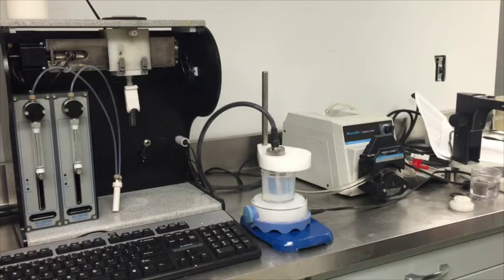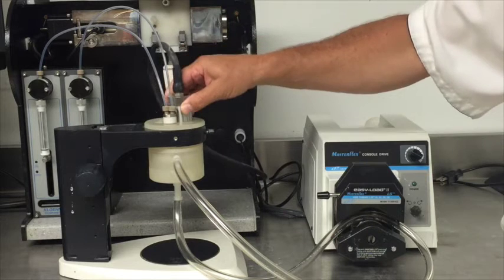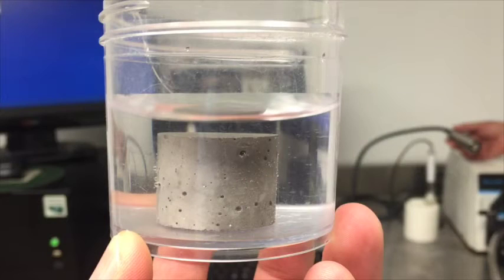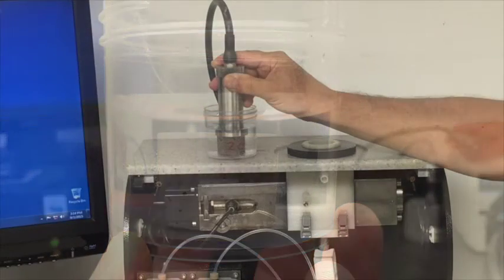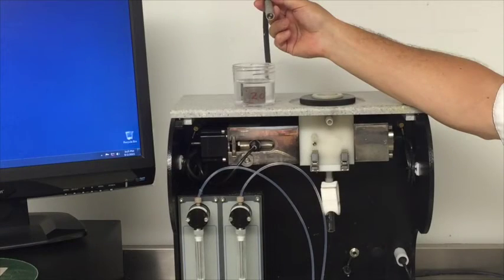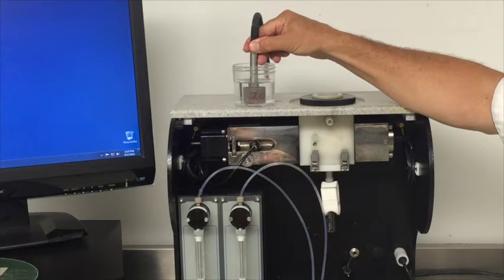We also have a special setup for the zeta potential probe for pumping sample through with a peristaltic pump. The injection probe for the titration burettes can be inserted into the sample as well, which would allow for conducting titrations of heavy viscous samples. When characterizing the zeta potential in porous materials, the probe can simply be placed in contact with a porous block, as we will demonstrate now. We also have a special setup for measuring the porosity of porous material with our aqueous conductivity probe, which functions at a high frequency of 3 MHz in order to eliminate electrode polarization.